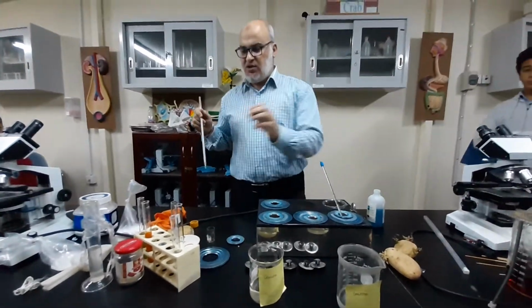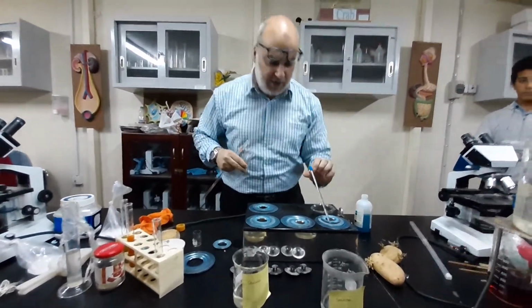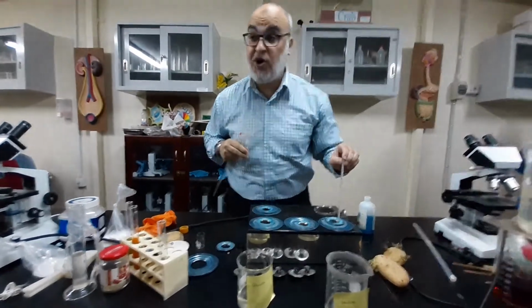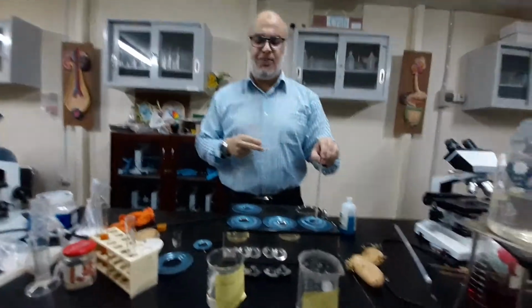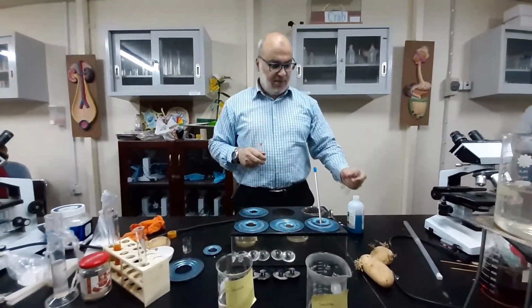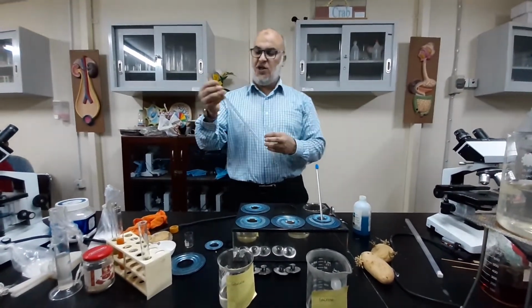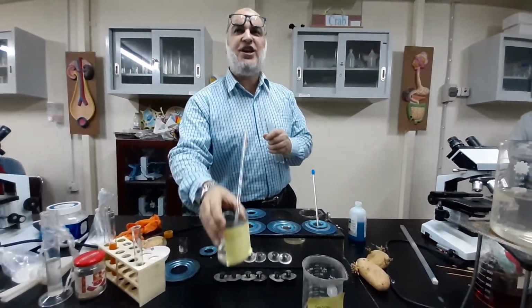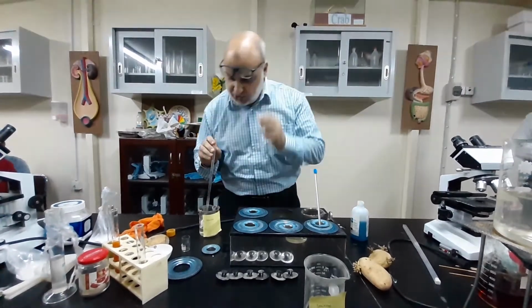The investigation requires a water bath. I already prepared it, and I checked the temperature. As you can see here, the temperature is almost boiling. It's 90 or above. This is the thermometer taking the temperature of the water bath. Water is inside here. And Benedict solution and the samples of two kinds of sugar. Here is the pipette. I'm gonna take around 2 milliliters of each and put it into a test tube.